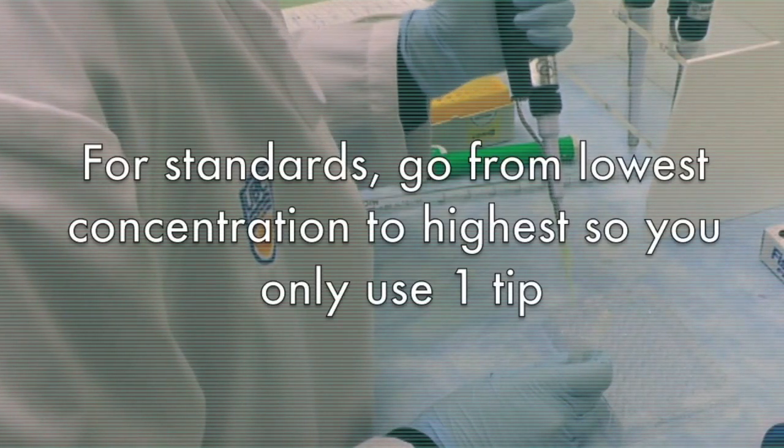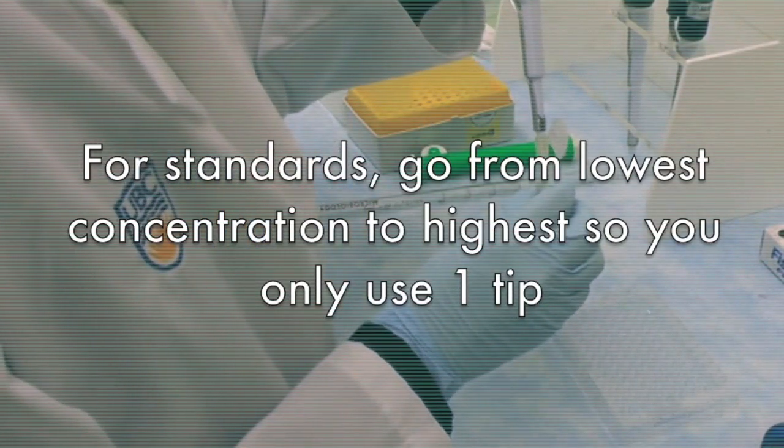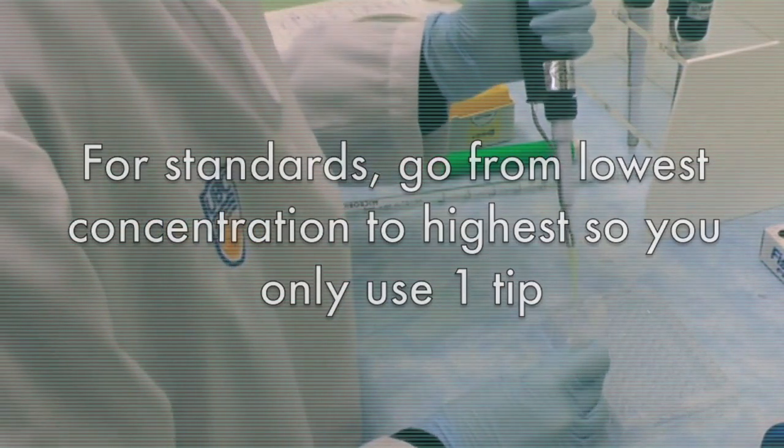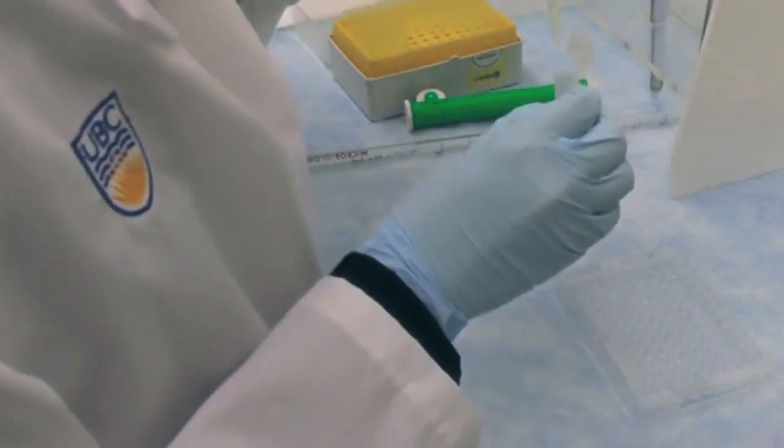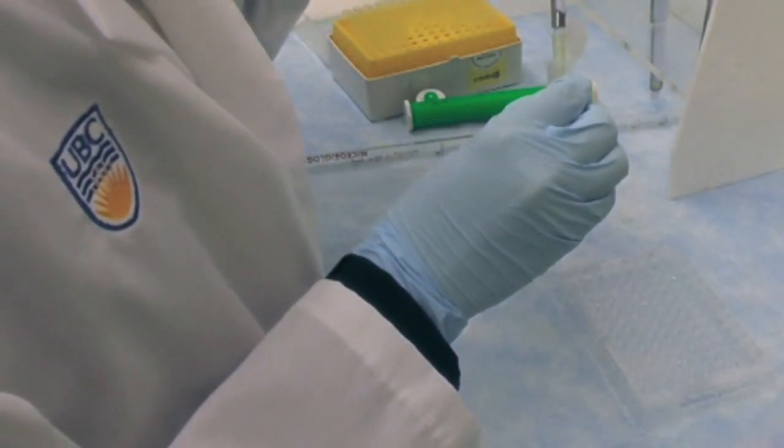Start from the least concentrated standard to the most, so you only need to use one pipette tip. For your samples, you should switch a tip for each dilution.